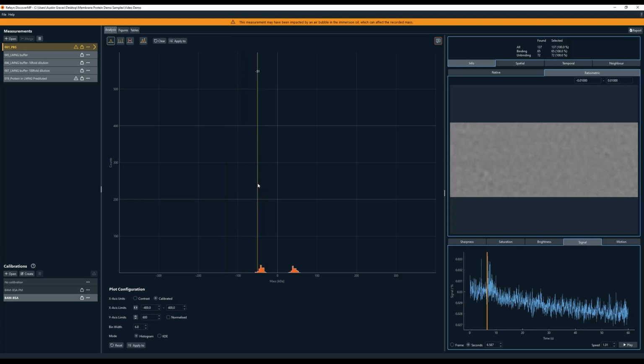Now, anytime we run a sample, it's not unusual to see some background signal from our buffer. This mostly is going to appear as two mirror peaks on either side of zero like this. This movie of PBS shows the minimal background signal we can expect when running a clean buffer.